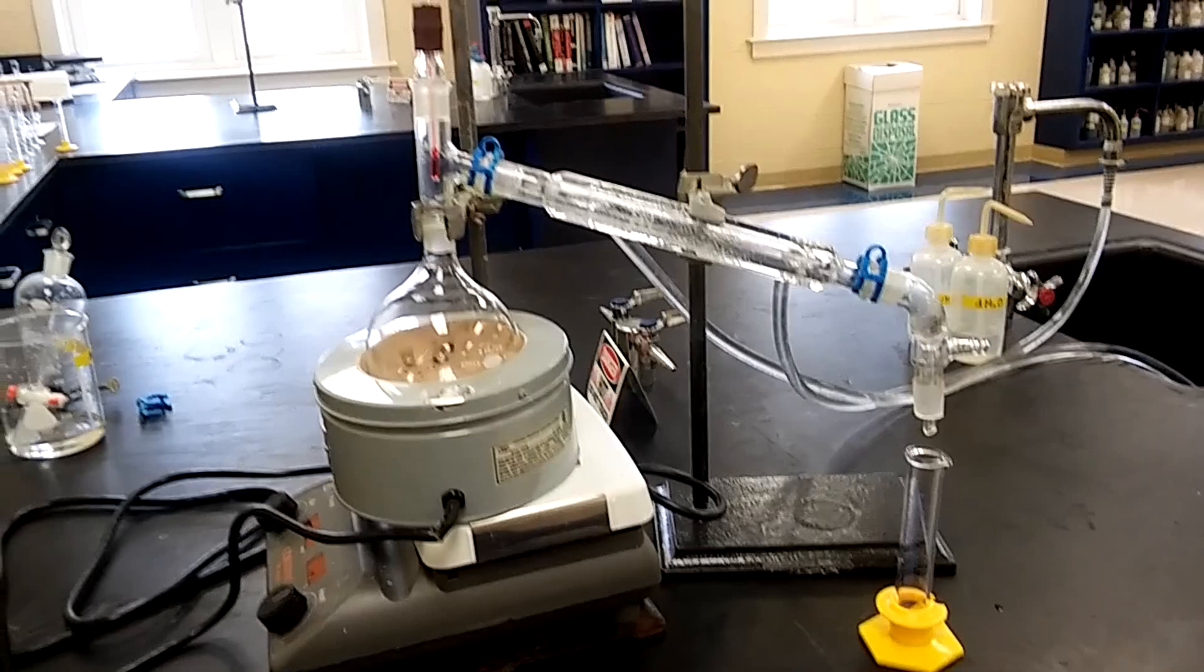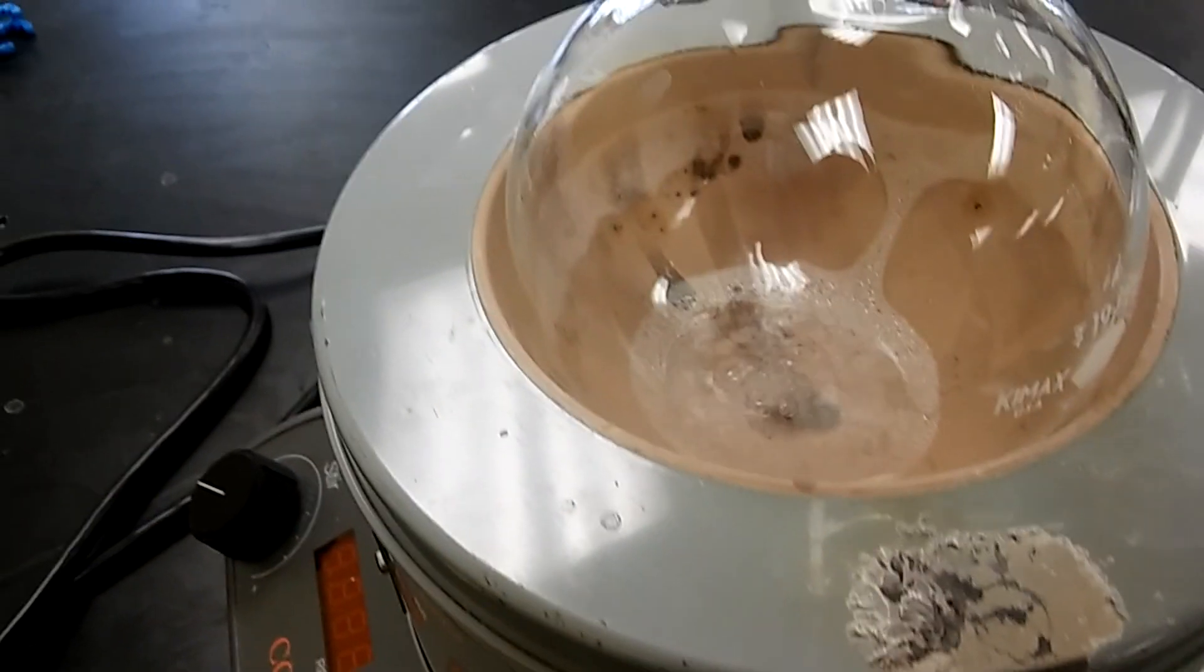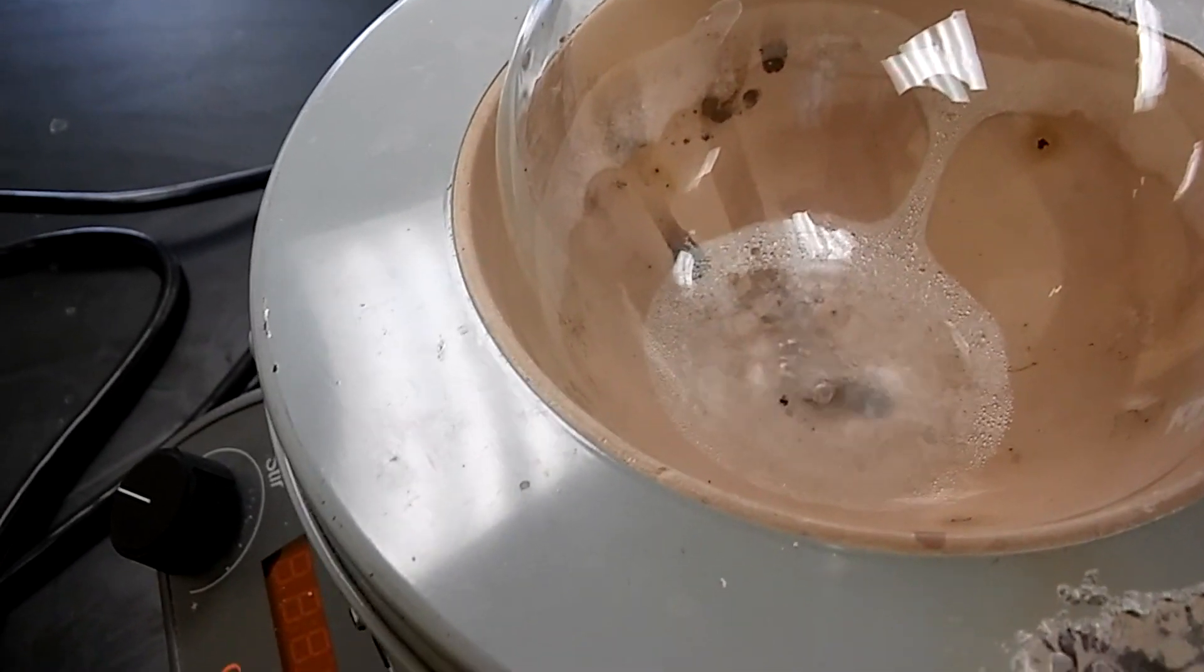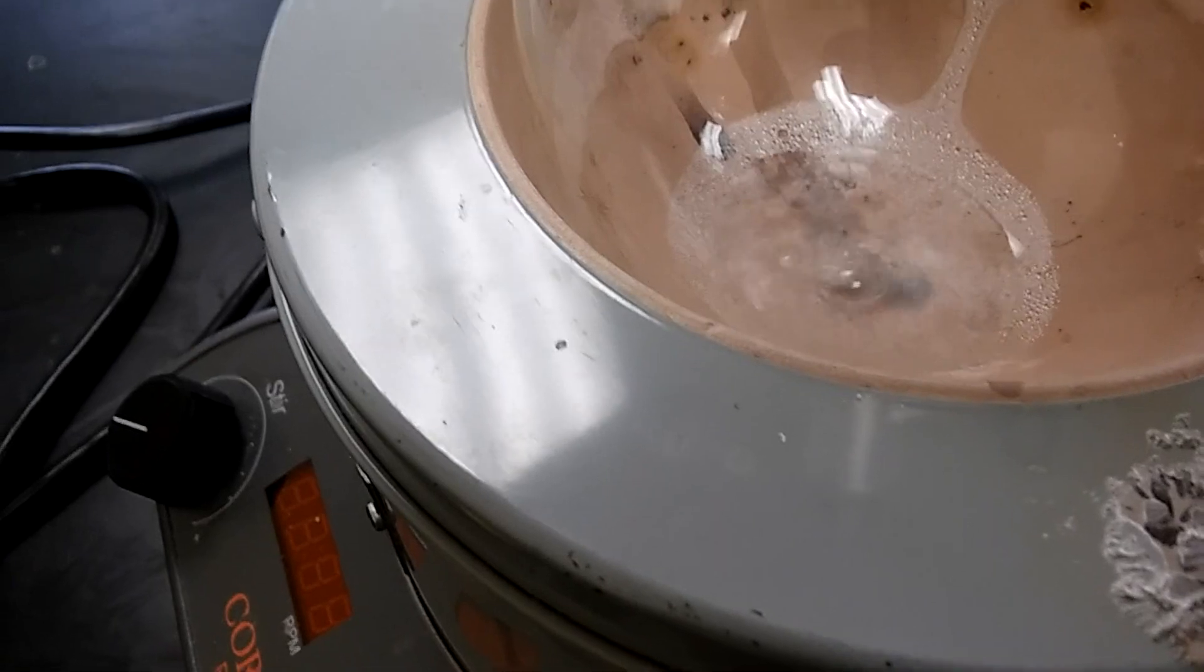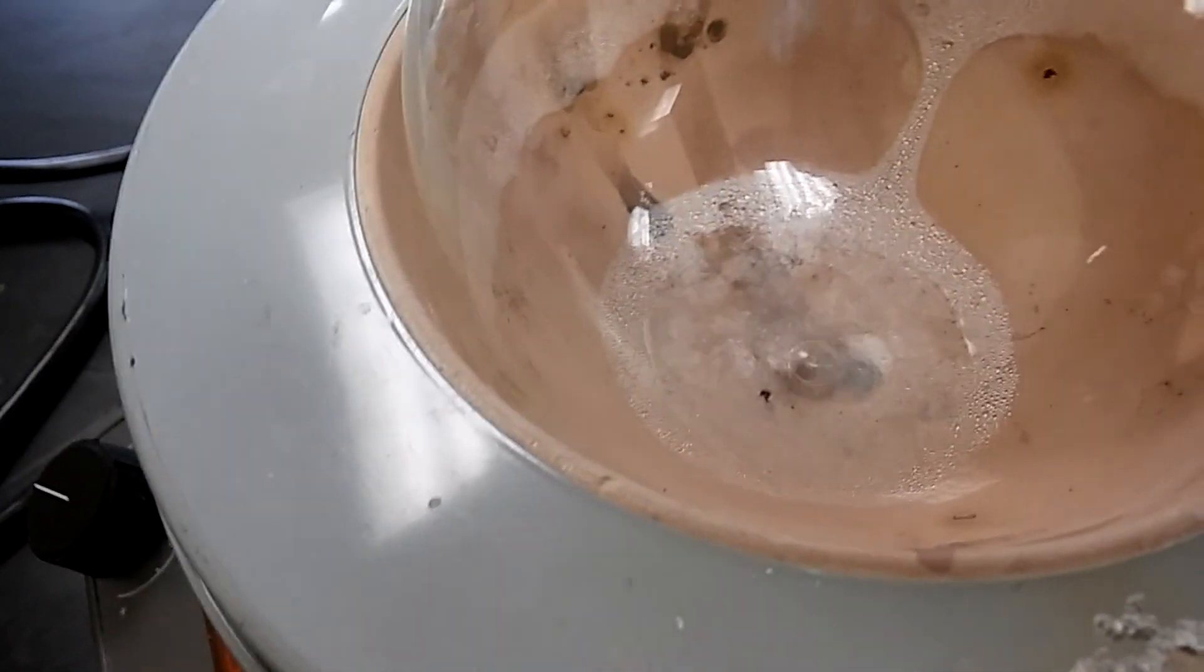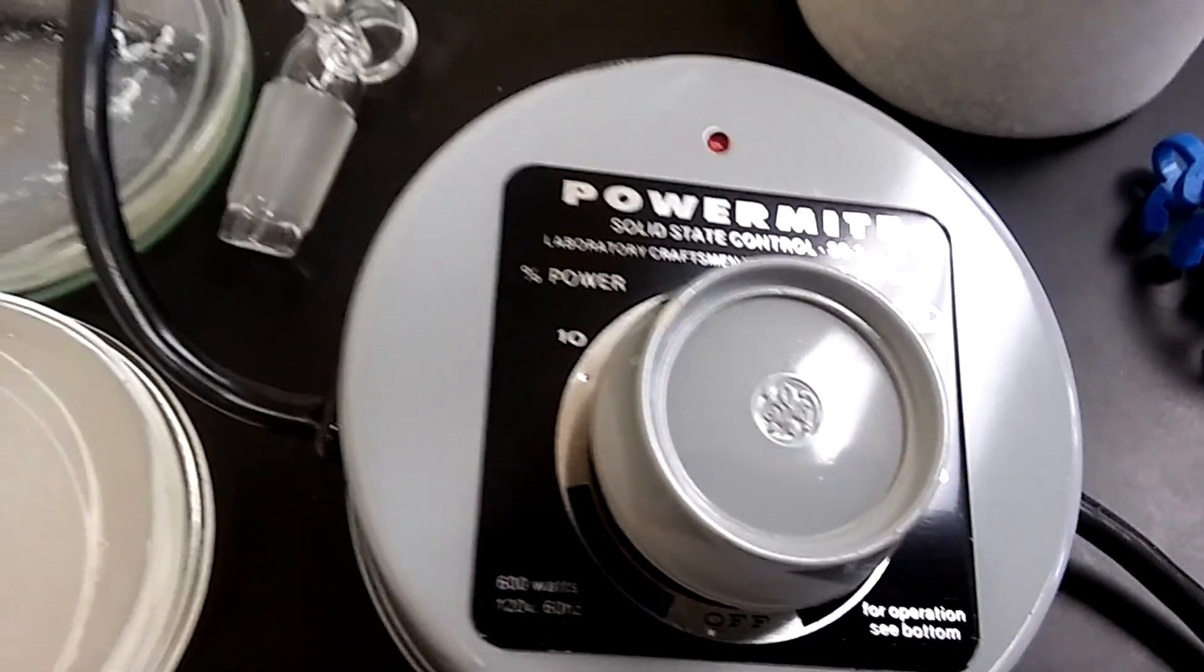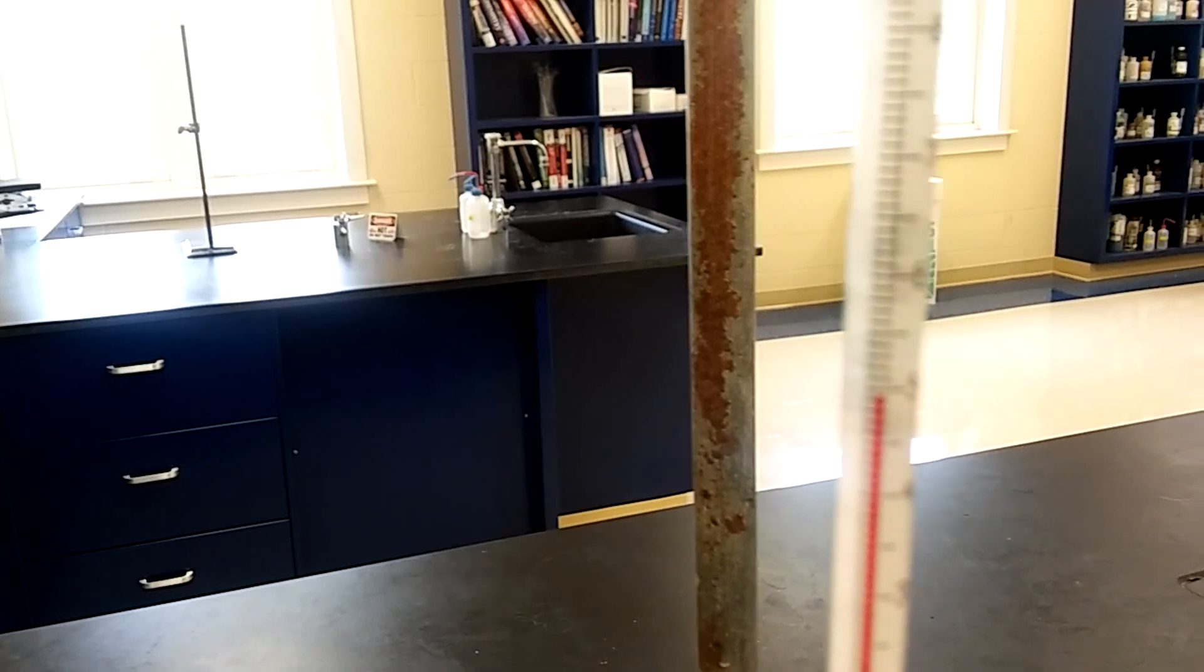I'm back. As you can see, there's gentle boiling - that's all you really need. Keep in mind we have such a small quantity of volume. If you put a ton of heat it's gonna evaporate and you'll be left with nothing. I've set it at about 20, that's probably good.